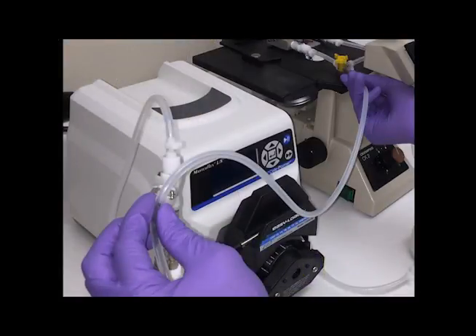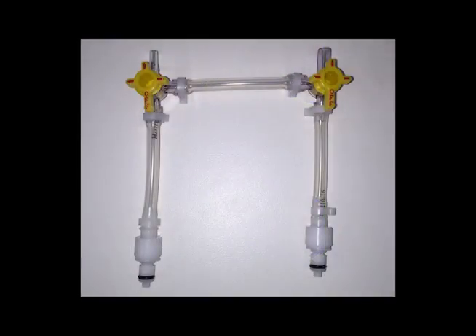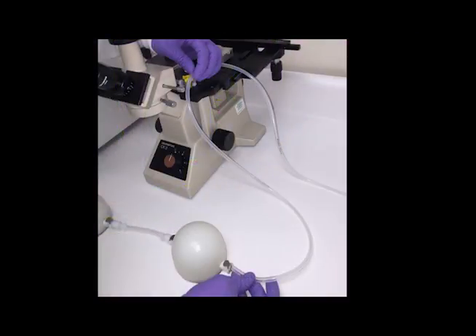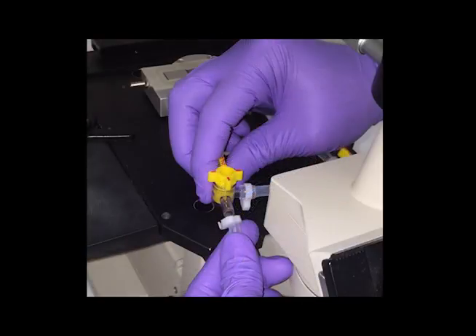Cut another length of tubing long enough to reach from the FlexFlow device to the media collection bottle. Connect the barbed end of a male quick disconnect to the tubing with a small tubing clamp. Connect this quick disconnect to the inlet quick disconnect attached to the short piece of tubing in the media collection bottle, and leave the other end of the tubing free. Locate the bypass connector included with the system. Connect the two male quick disconnects of the bypass connector coming from the stop cocks to the two female ports on the front of the FlexFlow device. The off position of the stop cock valve levers should be facing upward. Connect the free end of the tubing from the second pulse dampener to the free stop cock end leading to the inlet port of the FlexFlow device and secure with a small tubing clamp. Connect the free end of the tubing from the media collection bottle to the free stop cock end leading to the outlet port on the FlexFlow device and secure with a small tubing clamp.